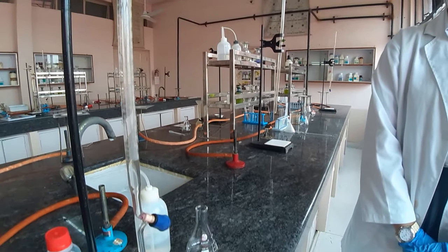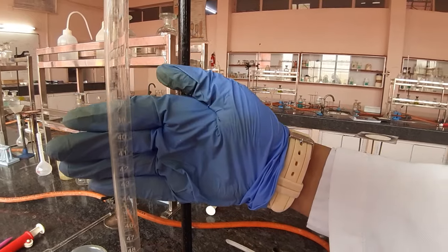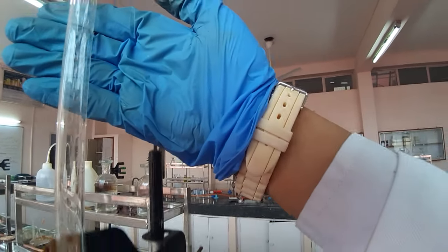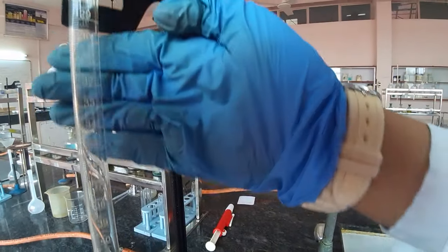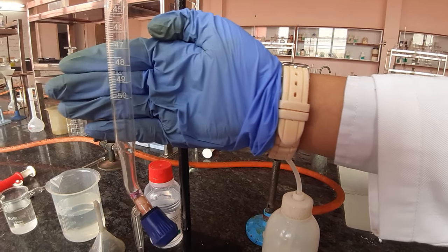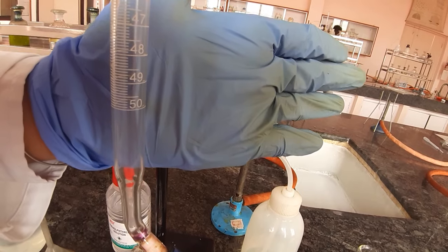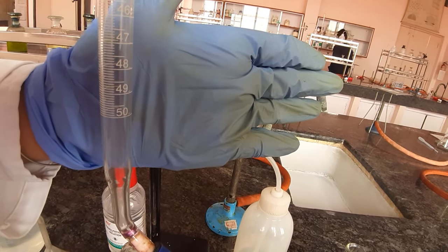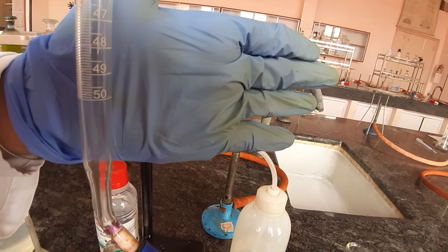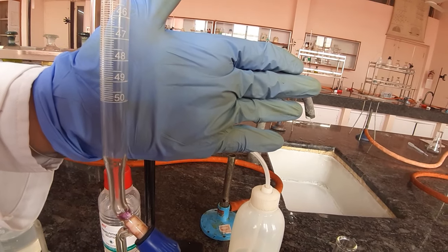This long tube has gradations in it — you can see values in it. It goes from 0 on top down to 50 at the bottom, passing through 20, 30, 35, 38, 39, and the last value is 50. Between 49 and 50, there are 10 lines, which means you can measure 49.1, 49.2, 49.3, 49.4, 49.5 at the long midline, then 49.6, 49.7, 49.8, 49.9, and then 50. Between two lines you have 10 divisions, giving a least count of 0.1 ml. You can measure volumes up to one decimal place when measuring through this burette.